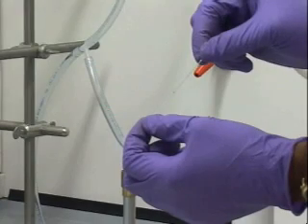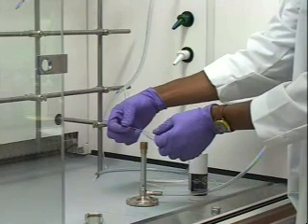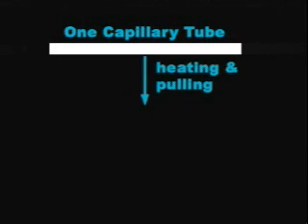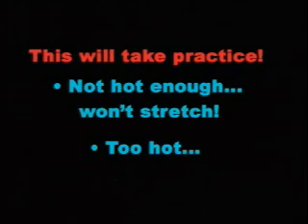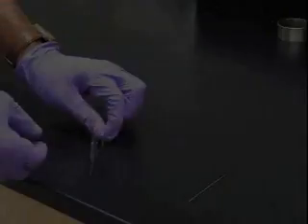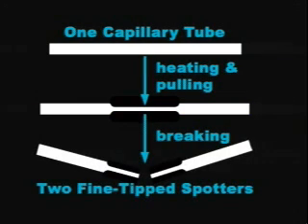Put the center of a capillary tube into the blue flame from a Bunsen burner and hold it there until the center starts to soften. Then, remove the capillary from the flame and pull on the ends of the tube. This causes the center of the tube to stretch and narrow. This will take a little bit of practice. If the tube isn't hot enough when you pull it, you won't be able to stretch it. But if you leave it in the flame for too long, it'll turn into a saggy mess. Once you have heated and pulled the capillary tube, break it into 2 pieces at the center. You should end up with 2 fine-tipped TLC spotters from every capillary tube.